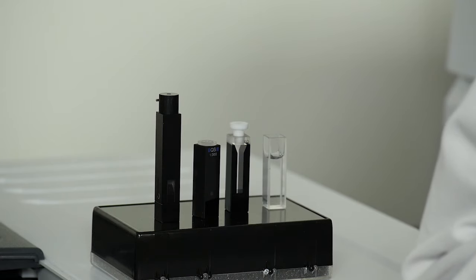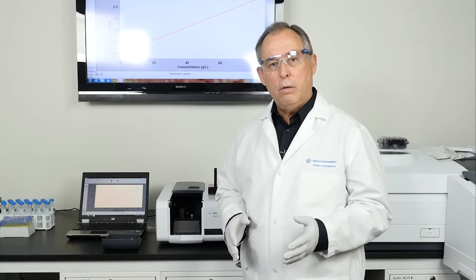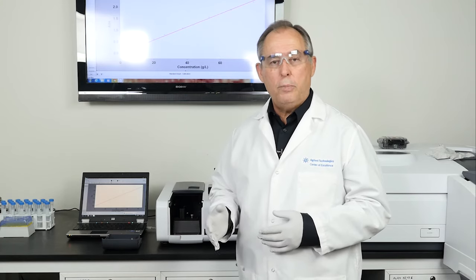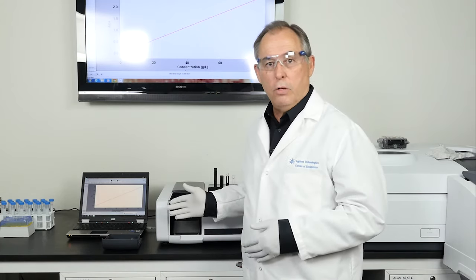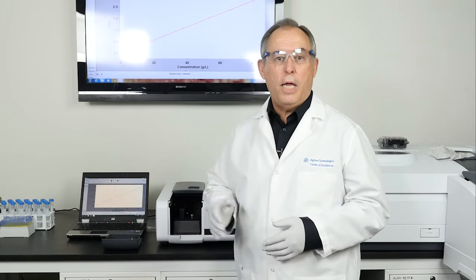The advantage of using the tray cell as opposed to a dedicated small volume spectrophotometer is that you can take the tray cell out and use your other standard cells for whatever application that you need to do.